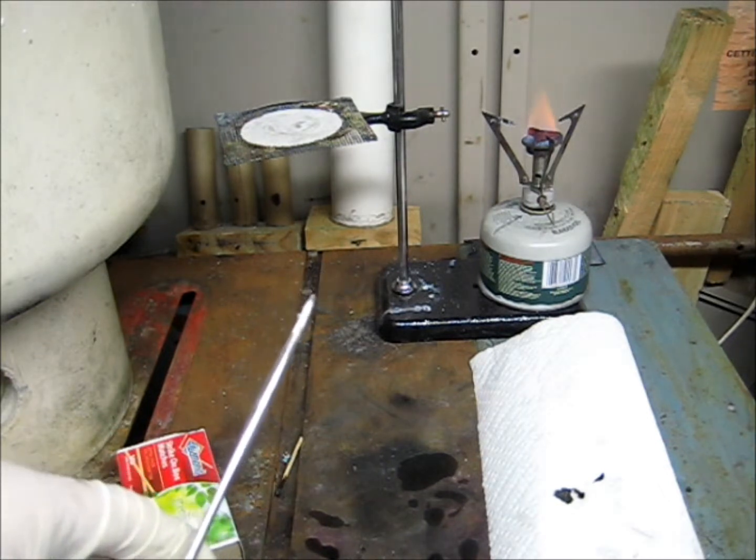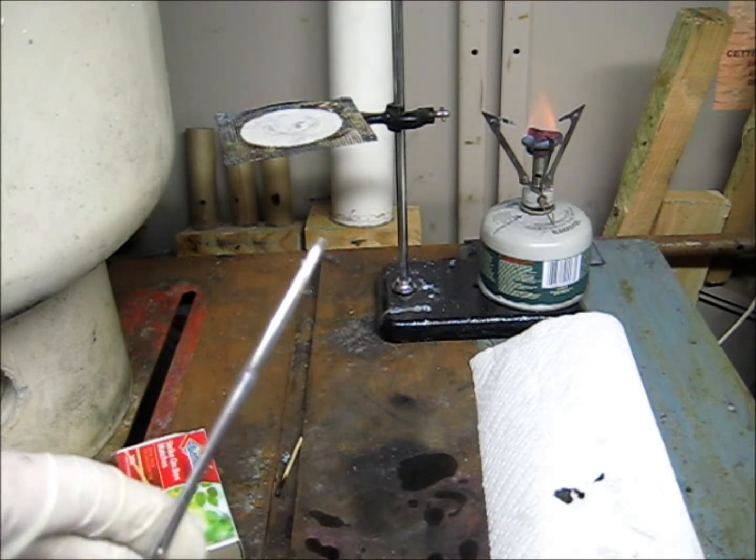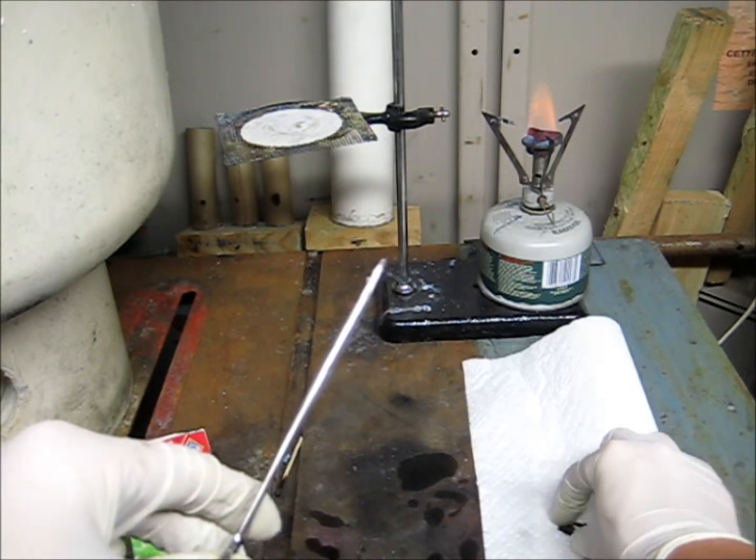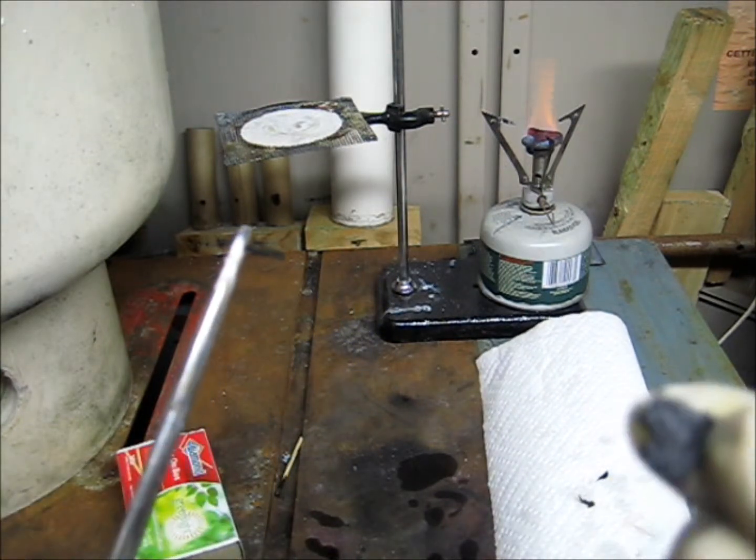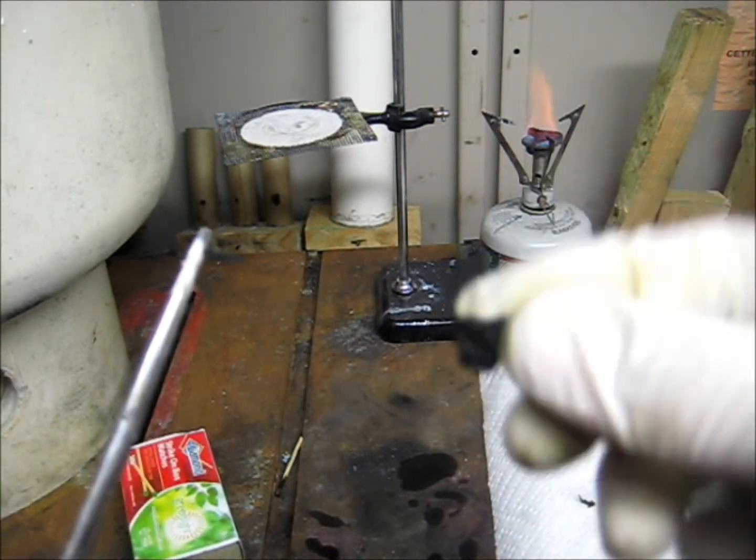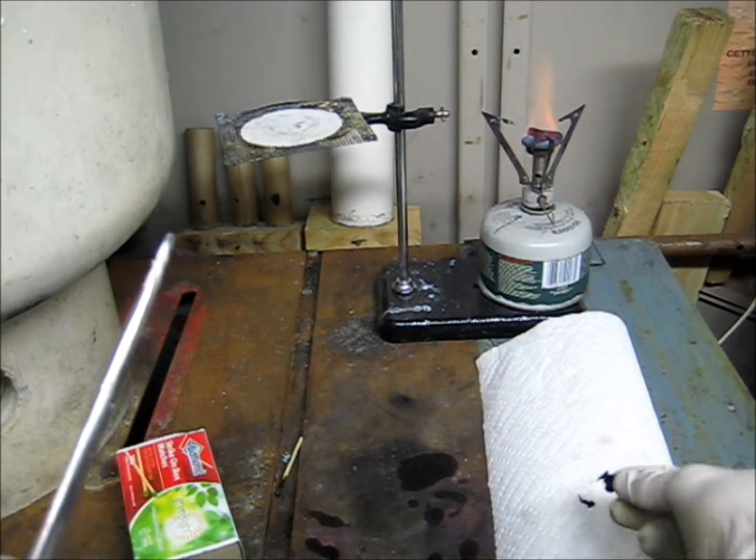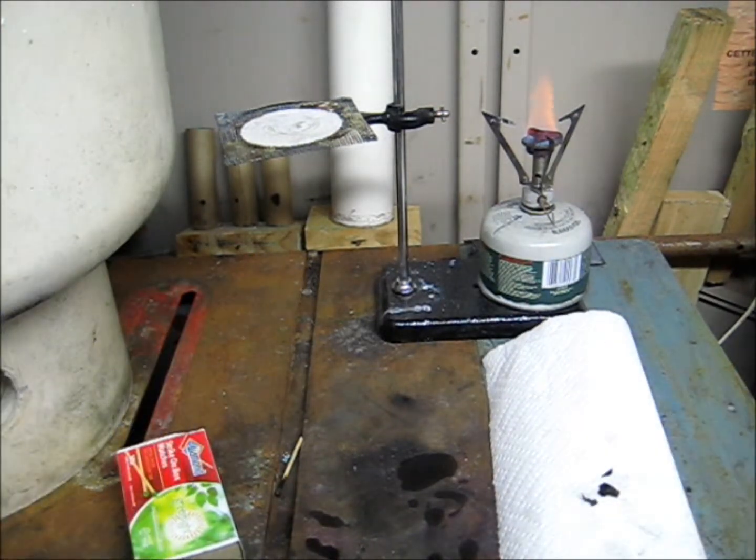So here you can kind of see that if it focuses in, we have some lithium and also right here, this is very oxidized so it is dark black. Lithium oxidizes with the air to form lithium oxide, but when it reacts with water it forms lithium hydroxide.